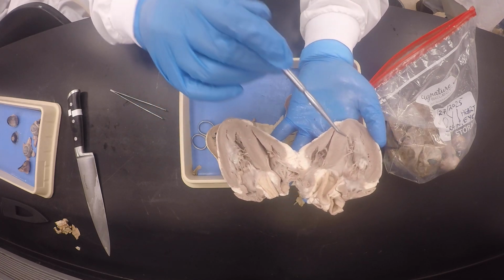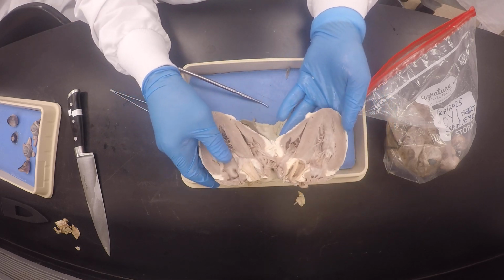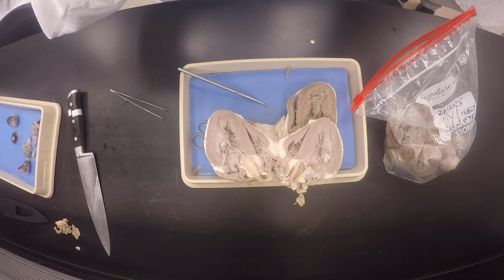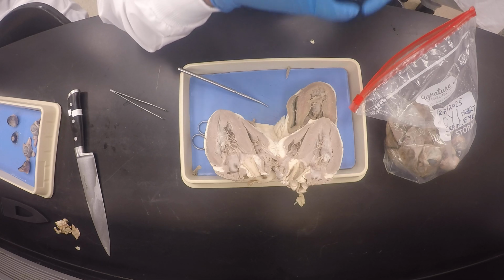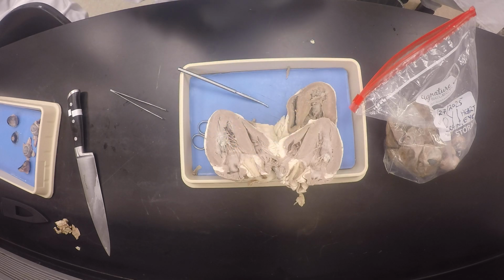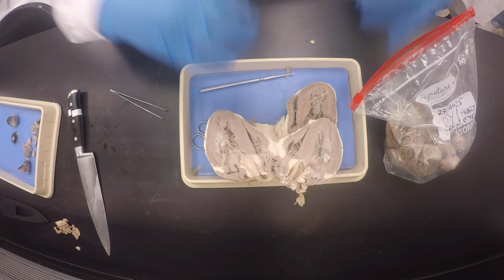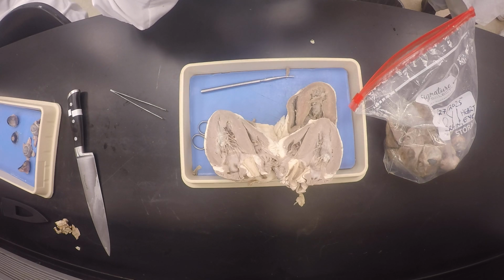And yesterday I was saying to the other class that the left side is pumping under high pressure, so it only has 2 cusps, and the 2 cusps meet at one point, which is a point where you could have leakages. So if you're pumping under high pressure, you want to reduce the number of points where you might have leakages. You understand? That's my reasoning for the left side having 2 cusps. The rest is attached around the ventricular myocardium, and the only point where they meet is one point where you might have a leak. So you are reducing your chances of having a leak because you have only one point of contact.